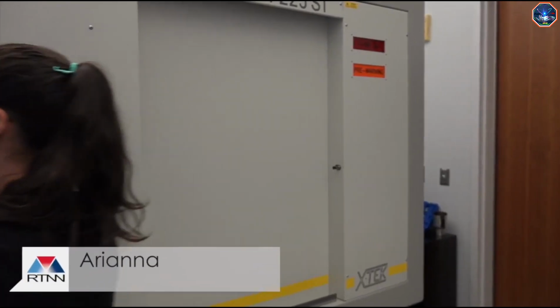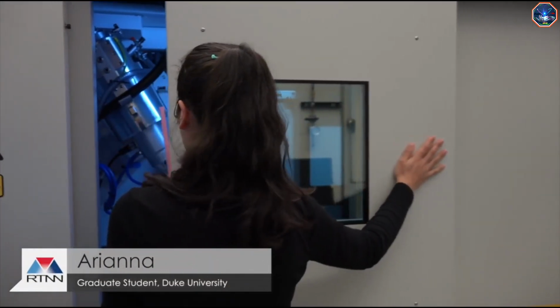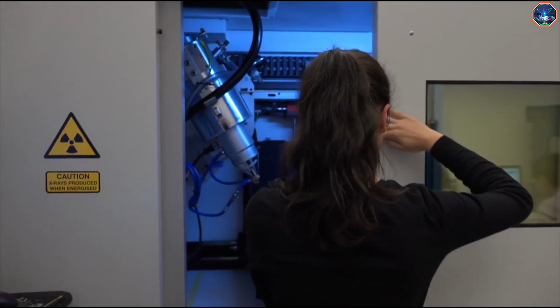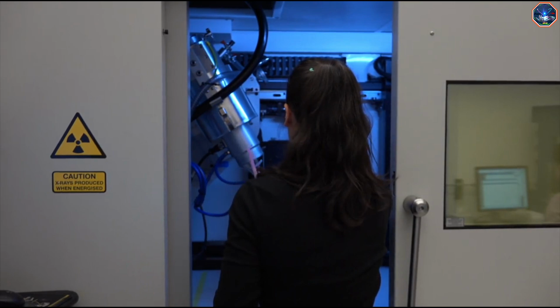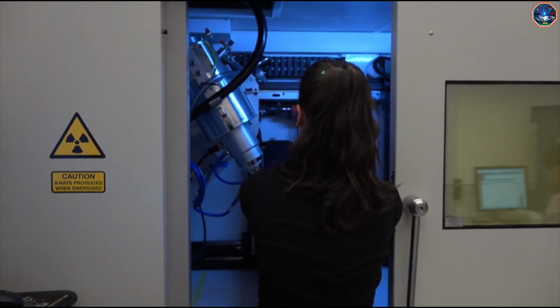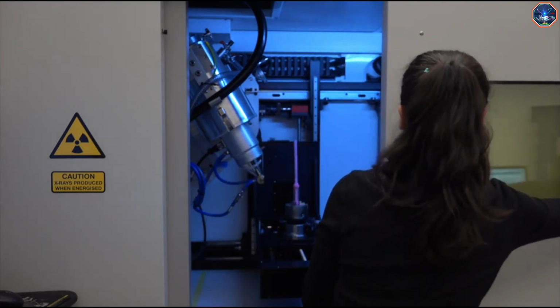I used the micro-CT scanner to study these fossils because they were very small animals. Some of them were only the size of a mouse. Small animals have very small bones that are difficult to describe and measure using just the naked eye. They are also more difficult to handle and easy to lose track of, which can be extremely stressful because fossils are irreplaceable.